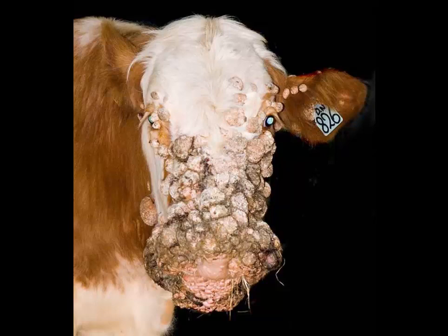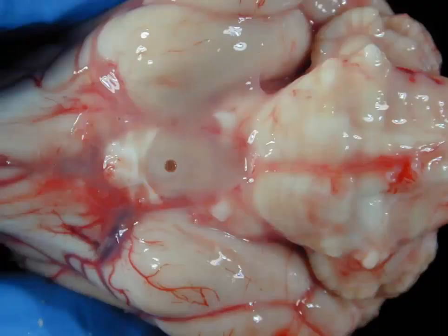Okay, that one was a lot of thinking. Let's move on to slide number 3, and this is going to be very straightforward. All I want from you is, this is tissue from a dog. How about a good morphologic diagnosis? Okay, time's up. Very straightforward.